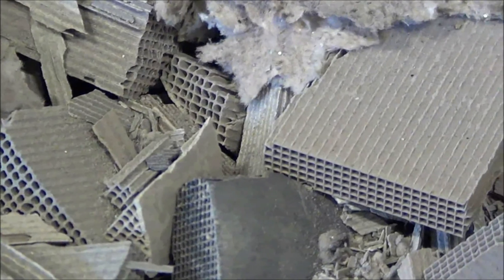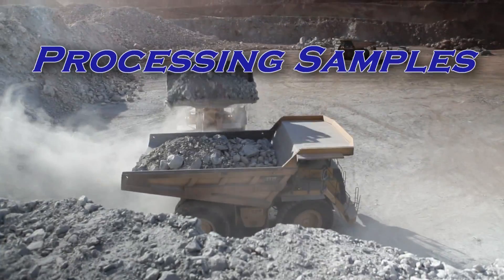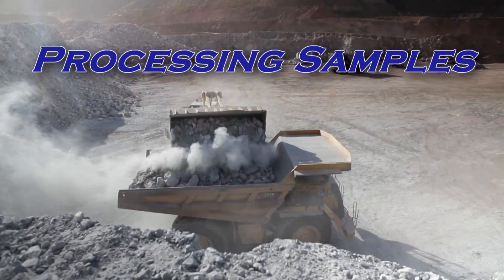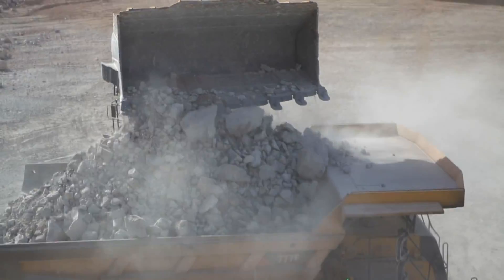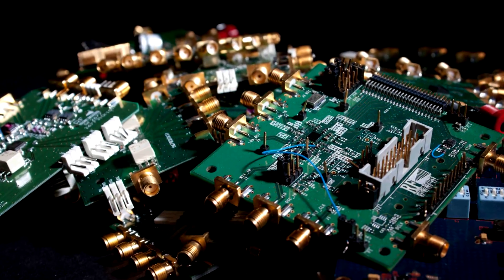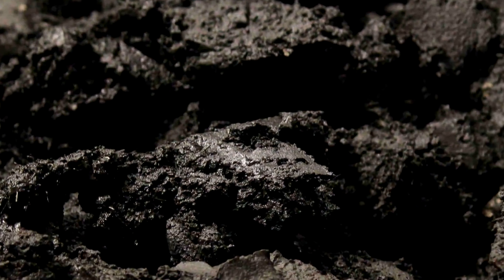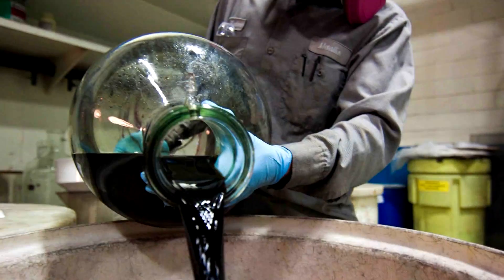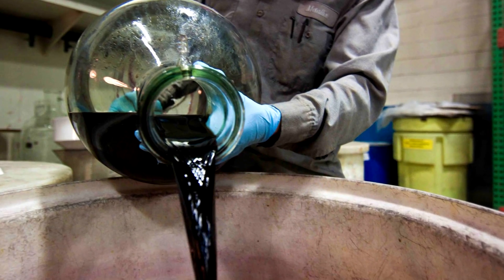Bulk lots of materials for sampling come in many forms, from mixed solids like crushed ore or scrap circuit boards for recycling, to sludge, slurries, and solutions from industrial processes.